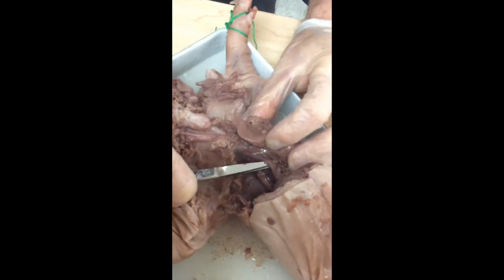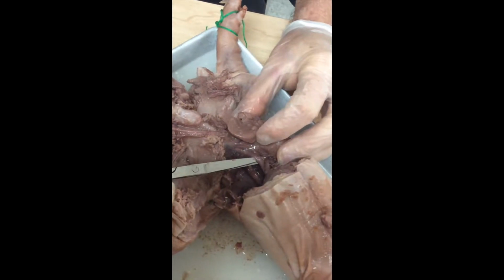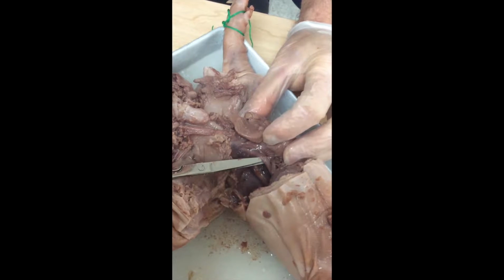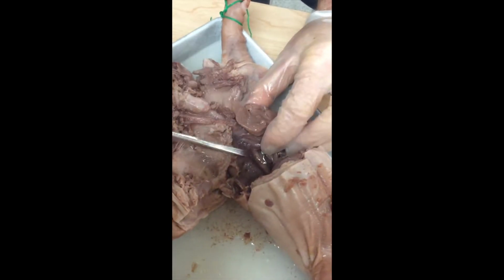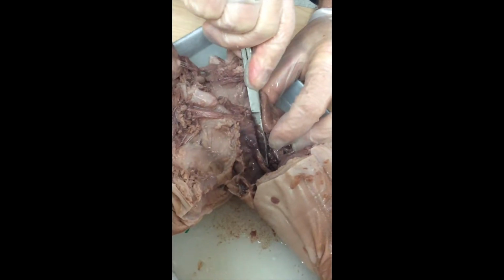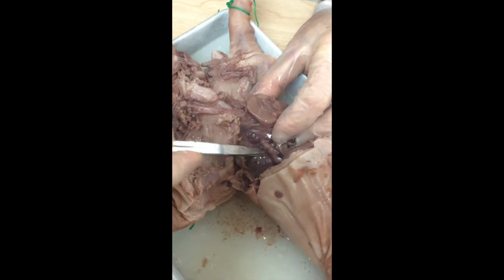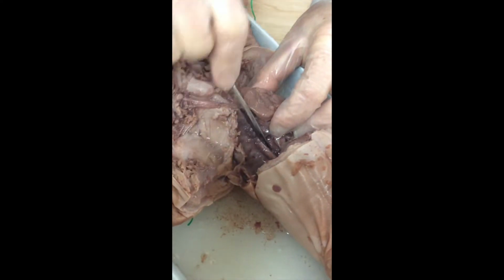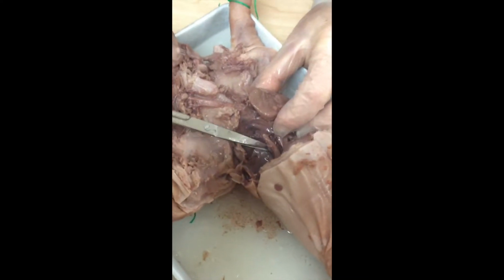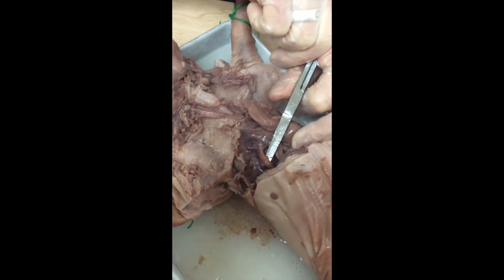That is not the esophagus. This is different than what we just looked at. That is a big old vein that carries blood from the lower body back to the heart. That is called the inferior vena cava. And literally stuck right underneath the backbone, we've got a huge artery right here. Many of you will already anticipate the name of that artery. That is the aorta. That is the largest blood vessel in the entire body.